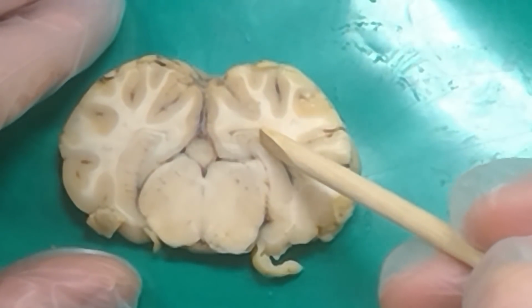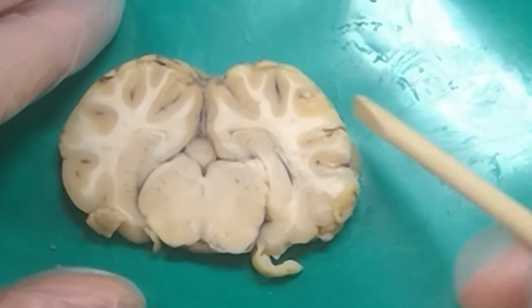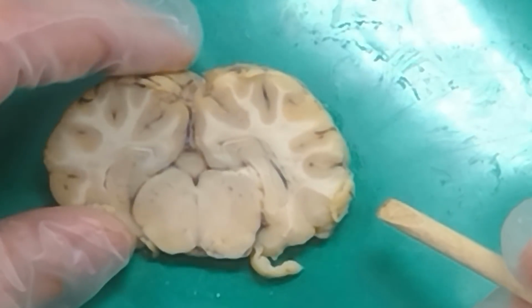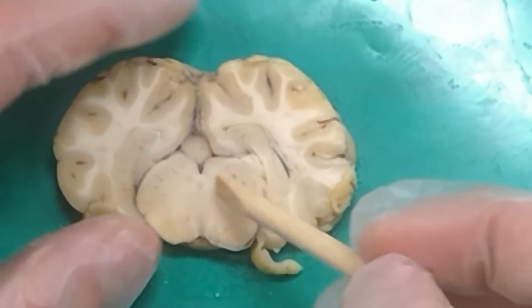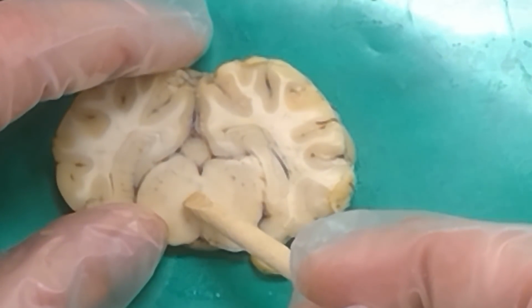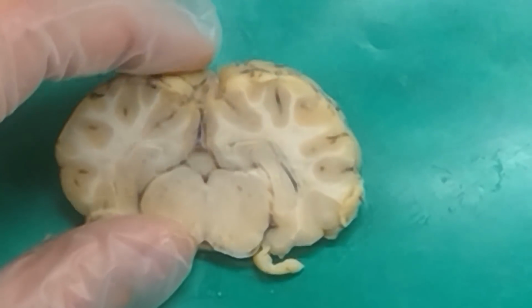Pineal gland. What is this guy right here? Hippocampus, right. And this is kind of still the, I guess it feels like it's more like, no, maybe we've moved on to the, so if you can see a hole right here, cerebral aqueduct, and in fact, maybe I'll use another, we'll do this one for this very end portion.